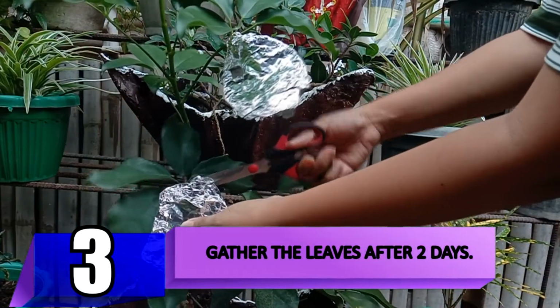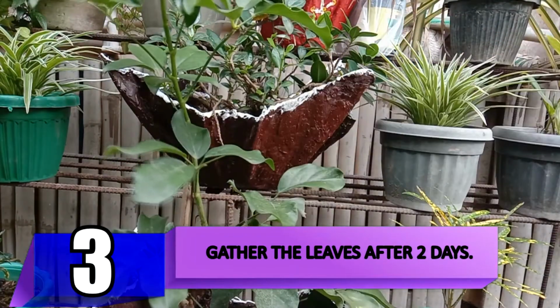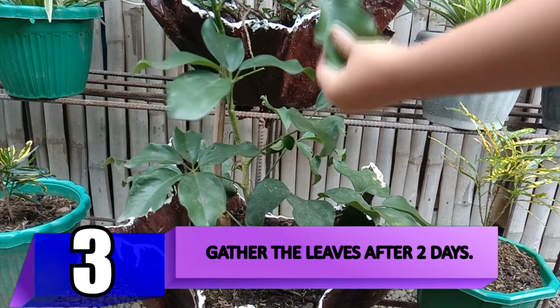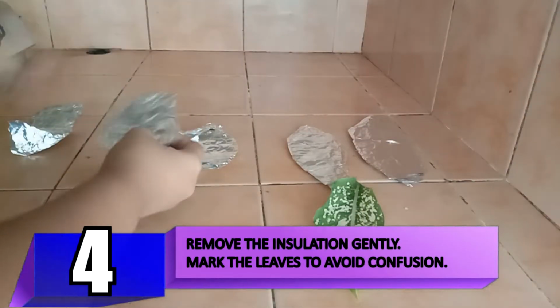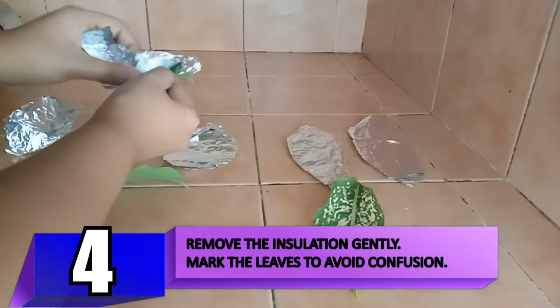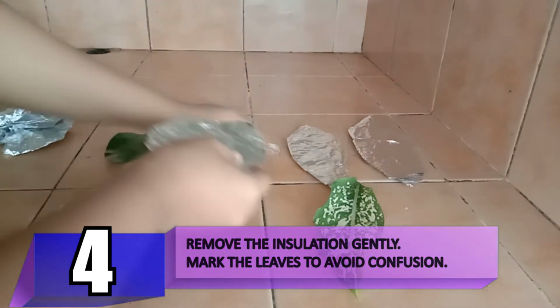Using the scissors, gather the leaves from the normal and variegated plants, both insulated and non-insulated. Remove the insulation gently and mark the insulated leaves so we can identify them later.